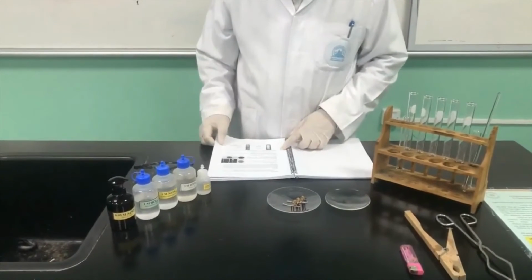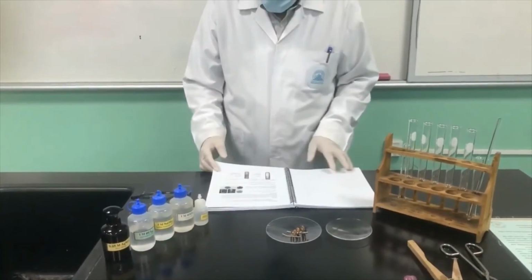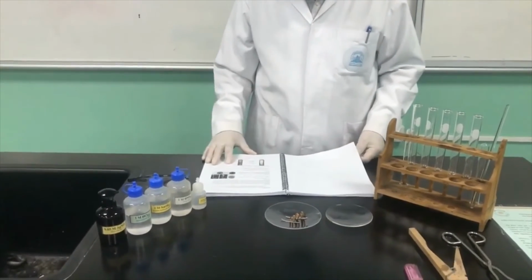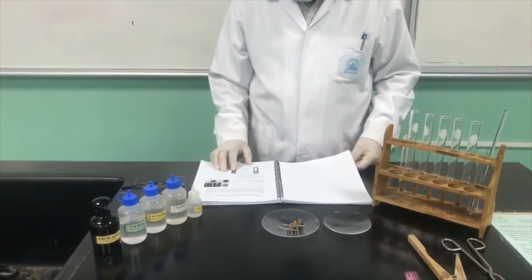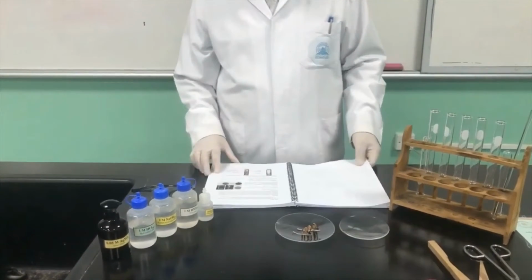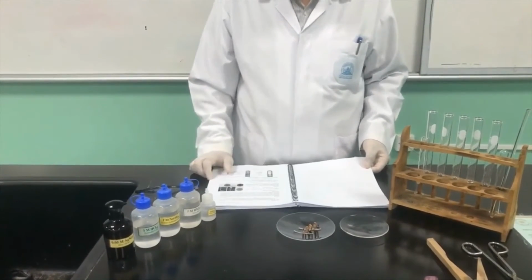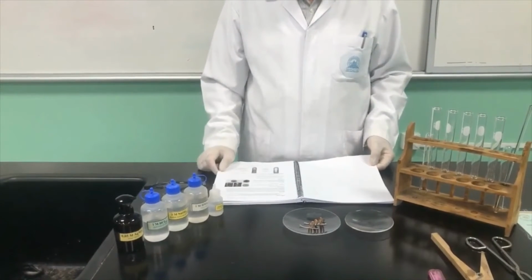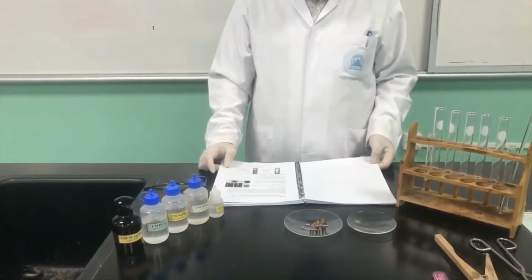Bismillahirrahmanirrahim. Assalamu alaikum, students. This practical session is about experiment number 3 regarding the types of chemical reactions. As you have understood in the theoretical class, chemical reactions can be classified into different types based on the rearrangement of reactants to give a product. So what kind of product we are going to get plays a role here in the classification of chemical reactions. This is one objective.